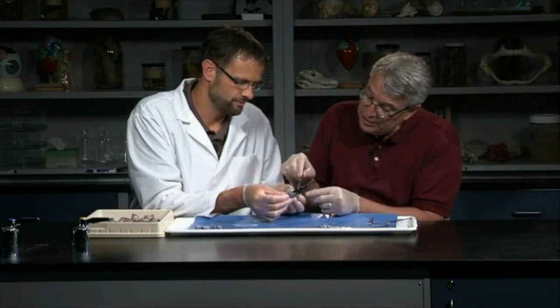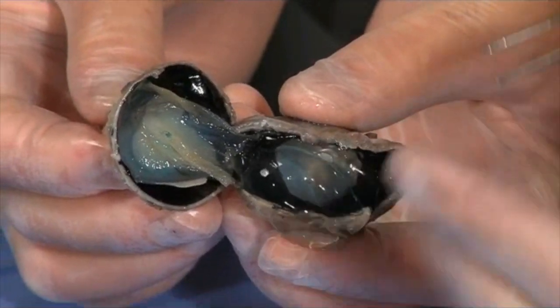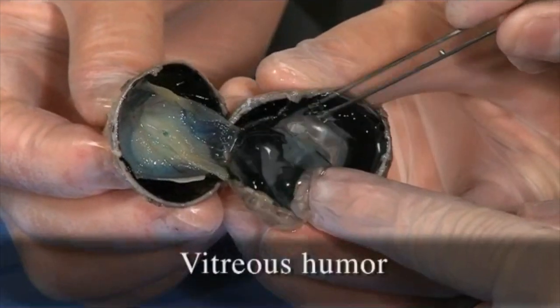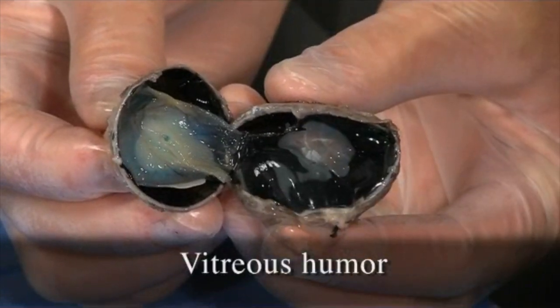Yeah, and then, obviously students will notice immediately that the eye is full of this big clear jelly-like substance. This is called the vitreous humor, and it fills the inner part of the eyeball and mainly helps the eyeball keep its shape.